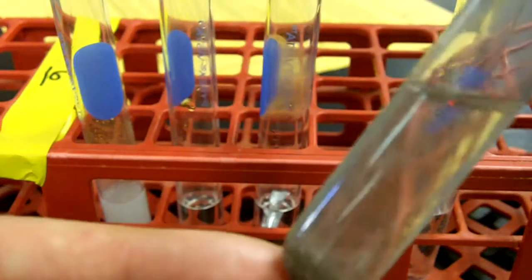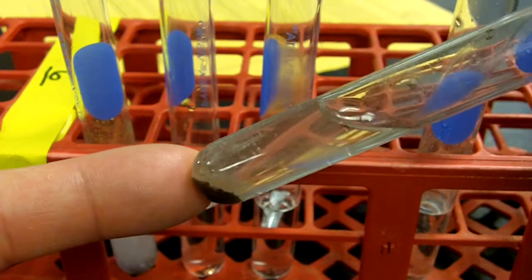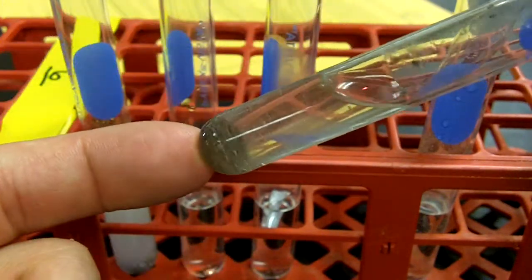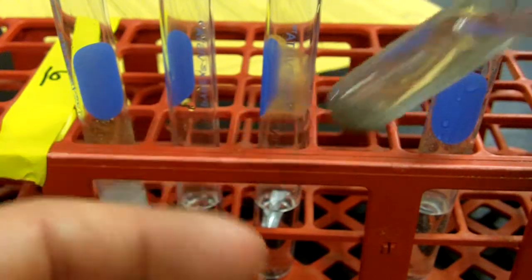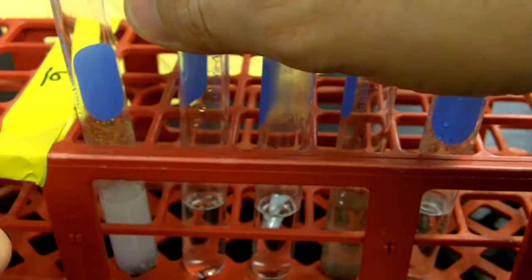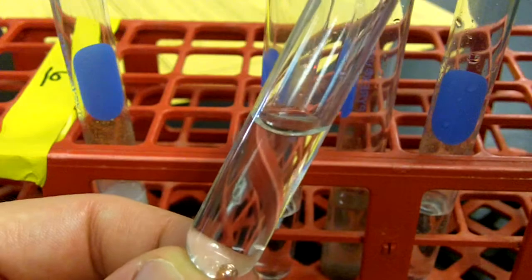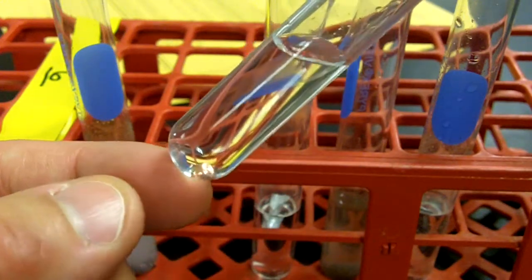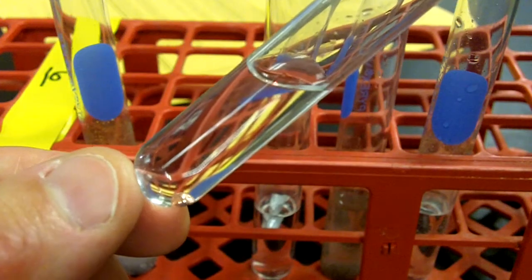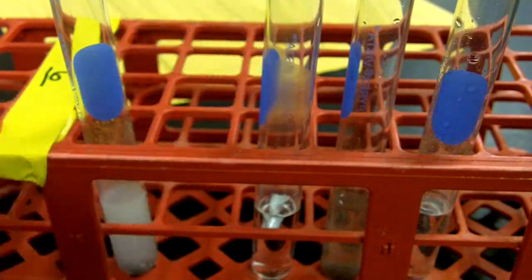Looking again at the iron one, you can see a difference there. Oh, there's some bubbles that are floating to the top as I rotated that iron dirt around. You can see them here on that top edge. So definite bubbles there. No heat for the iron. That leaves the copper. The copper, this metal is not more active than the hydrogen. So copper, actually, there is no reaction. So put no reaction for copper, in that it does not react with the hydrochloric acid.